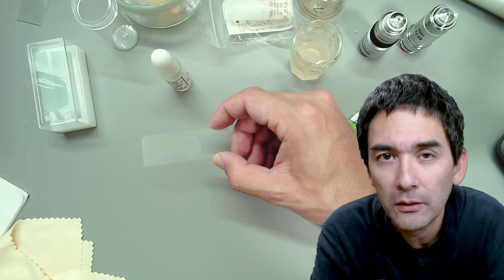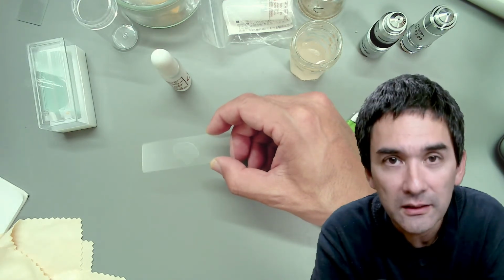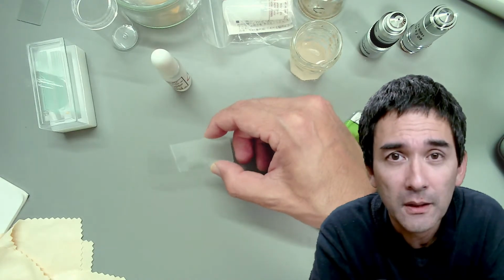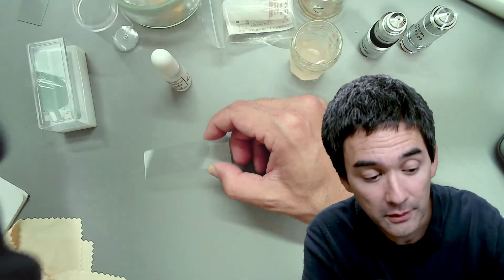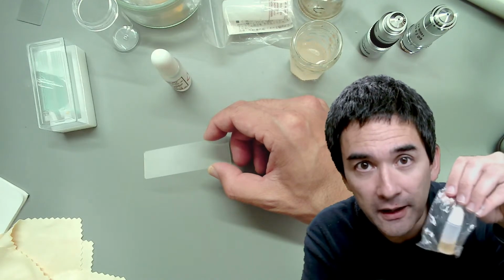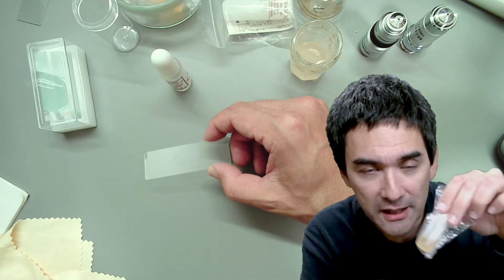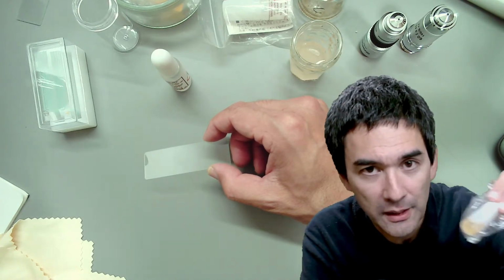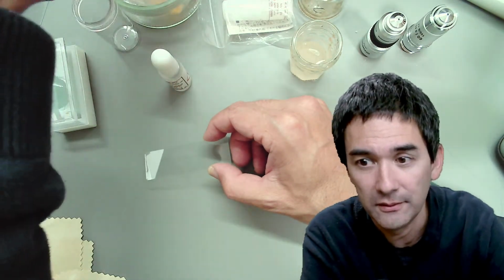If you store the objective lens for long term, it is important that you really clean off the oil for two reasons. Number one, it's going to collect dust otherwise. And number two, remember those oils that I showed you before, the yellow ones, they solidify over time. You really want to make sure that if you use those natural immersion oils, you have them removed. Otherwise, they are going to turn hard on your lens, and you don't want that.